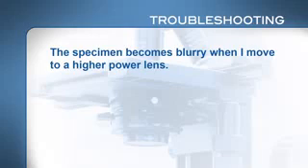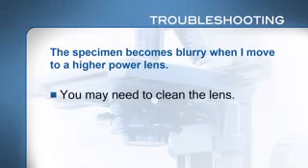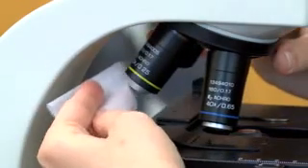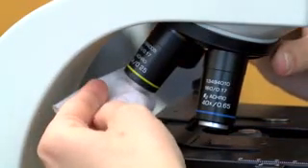you may need to clean the lens. Soak a piece of lens paper, and only lens paper, with lens cleaner and wipe the lens. Then wipe dry with clean lens paper. Repeat a couple times. If this doesn't solve the problem, check with your instructor.